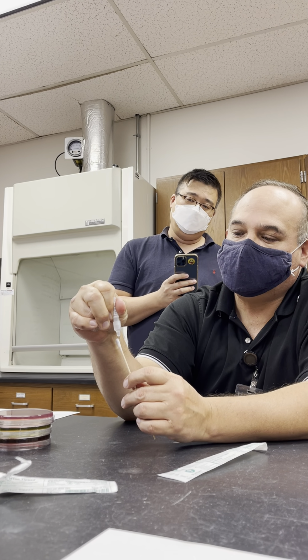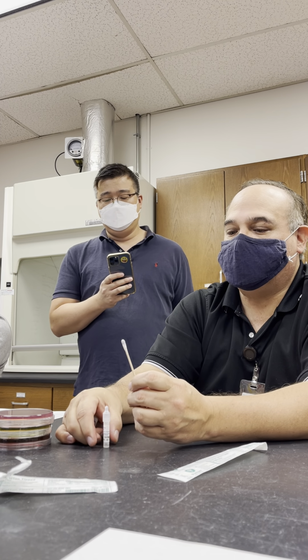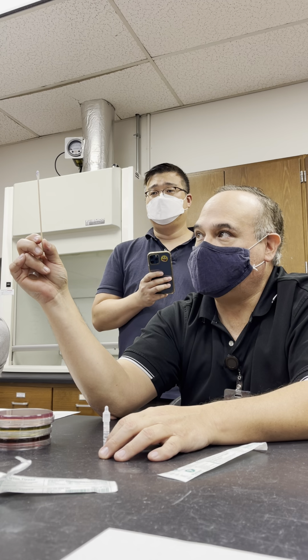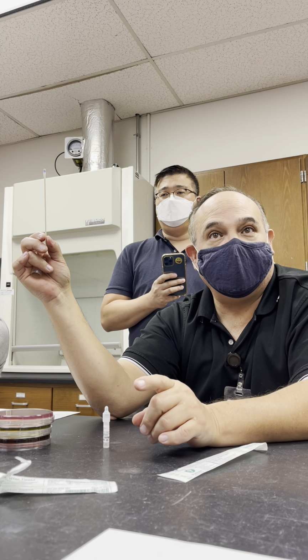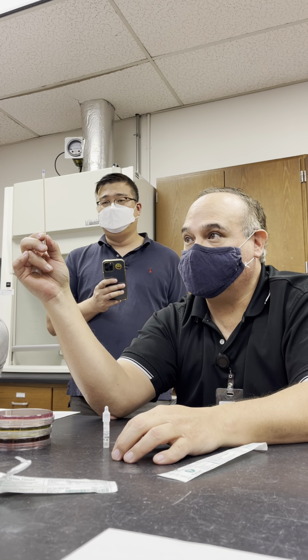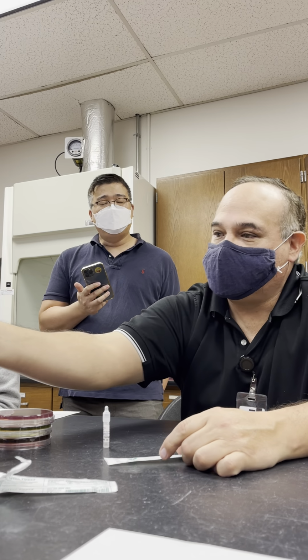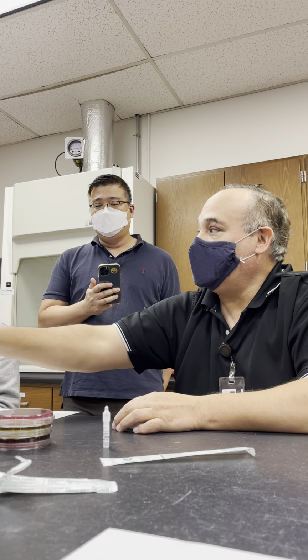1001, 1002, 1003, 1004, 1005, 1006, 1007, 1008, 1009, 1010. It's turning purple. See it? That means it's a non-enteric and it is aerobic. Okay? Hold that, Gio. Don't eat it. Okay. You call it positive or negative? Positive, ox-pos. And positive is non-enteric.